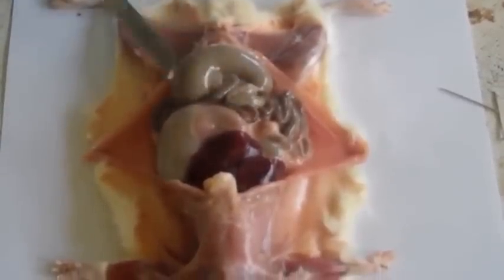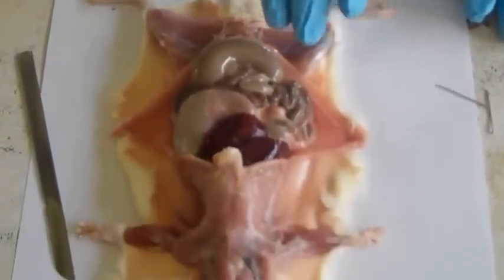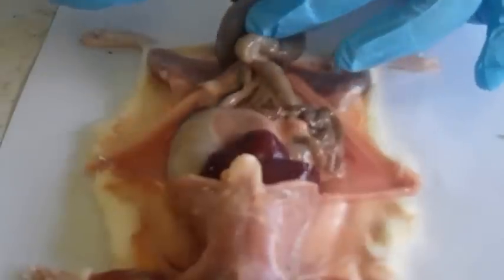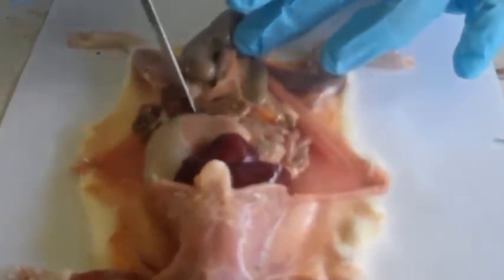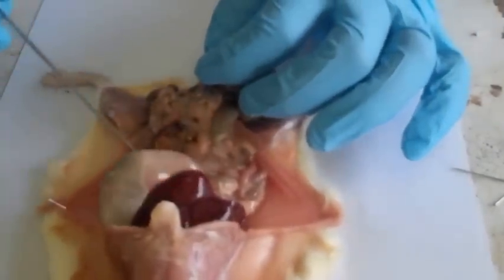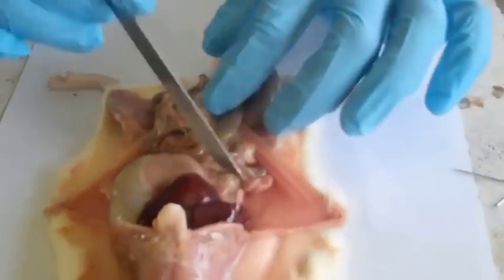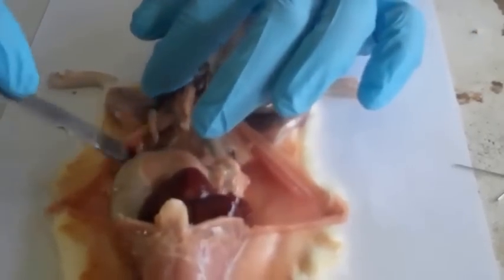And yeah, so next we're going to displace the ileum to the left of the animal, which is my right, so that we see the structures that have been hidden under there. We're going to displace the ileum to the left of the animal so we can see the structures, like my colleague said earlier on, that are within it. The ileum is a bit long and very much coiled, but we'll displace it anyway.